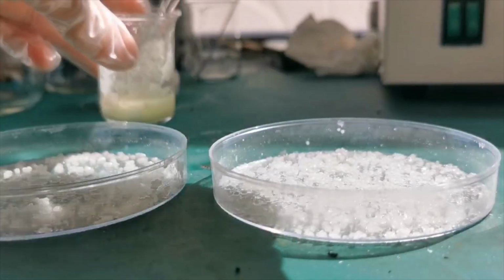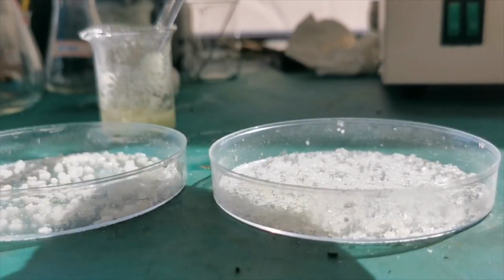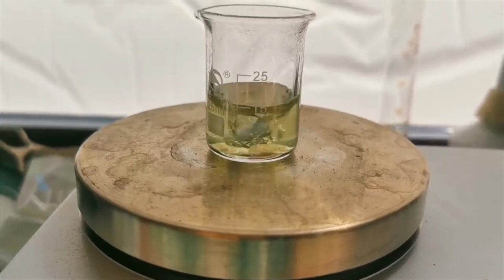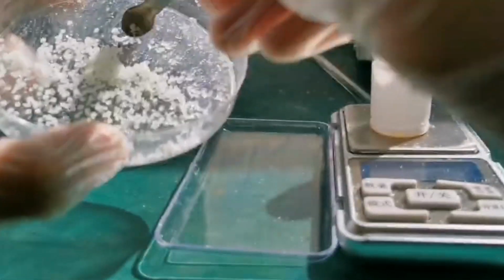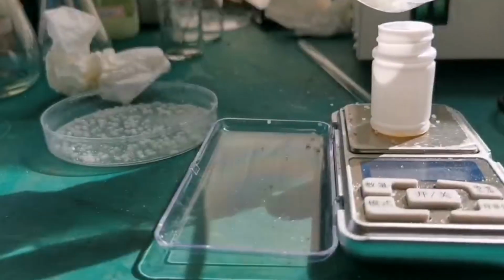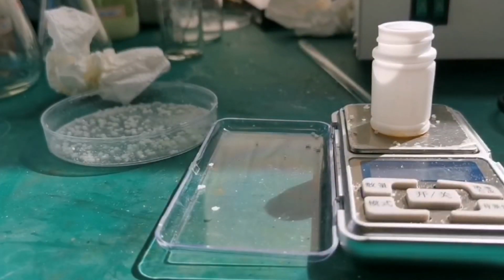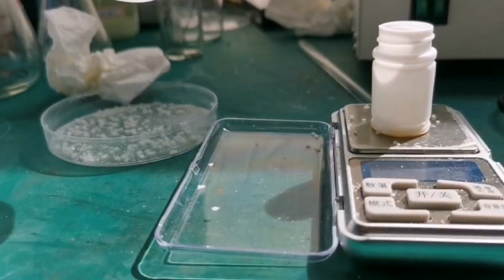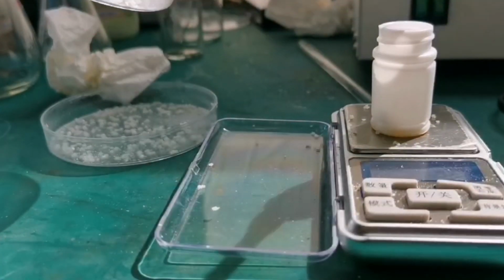A much better idea is to decant the mother liquor when it is still warm to limit the amount of crystals forming. My crystals in the petri dish are already quite dry, so I scraped them off using a spatula and transferred them to a vial for storage. This is quite a messy process, since the crystals are very small and easy to spill out. You can see from the video that I spilled some all around the table.